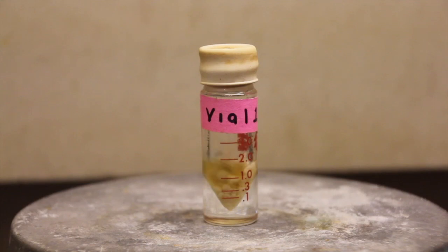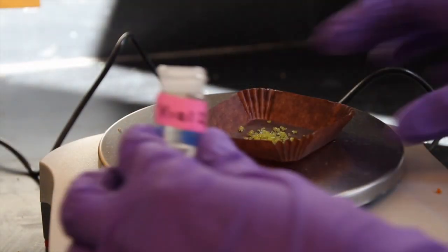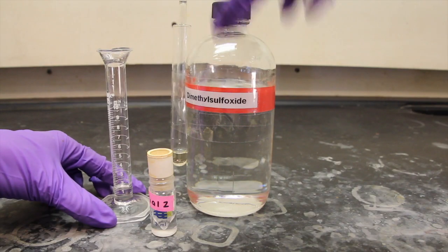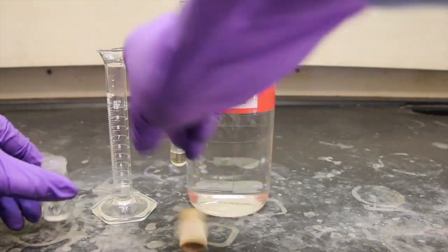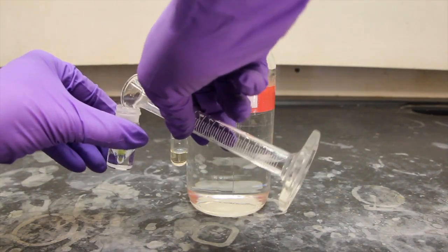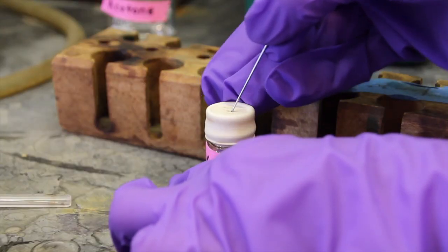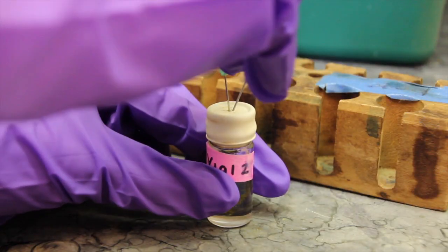Stir the mixture with a magnetic stirrer. In a second 3 milliliter reaction vial, add 0.35 grams of finely ground iron chloride and 1.75 milliliters of dimethyl sulfoxide. Quickly cap it with a septum before flushing and sparging it with nitrogen for one minute. After removing the needles, shake vial 2 vigorously in order to dissolve all of the iron chloride.